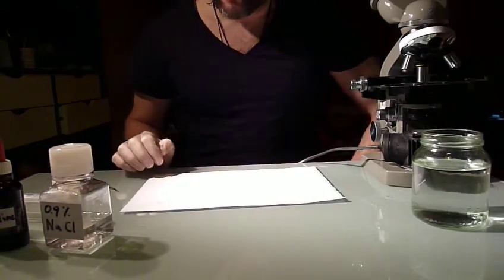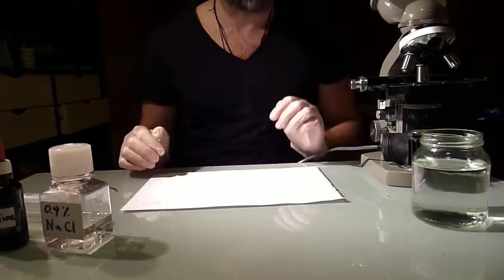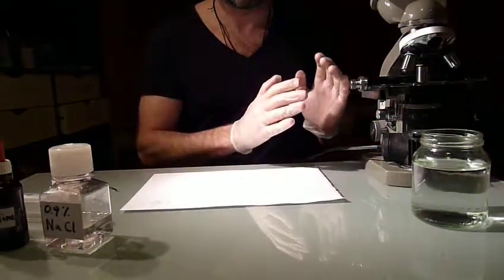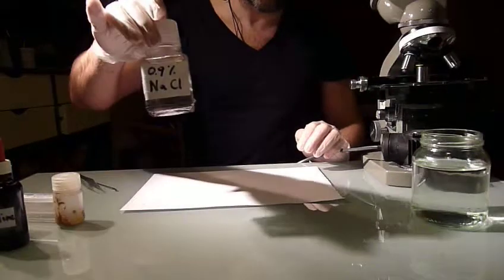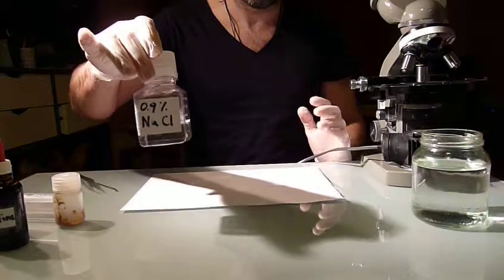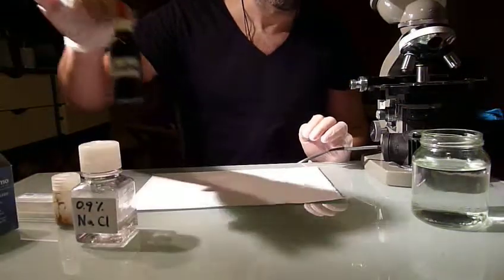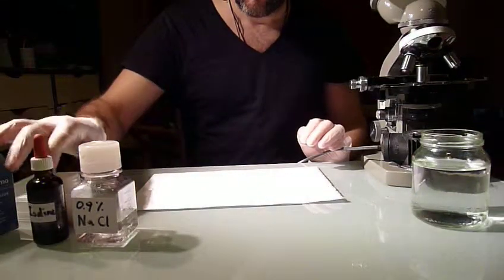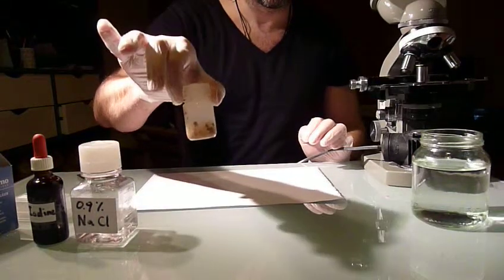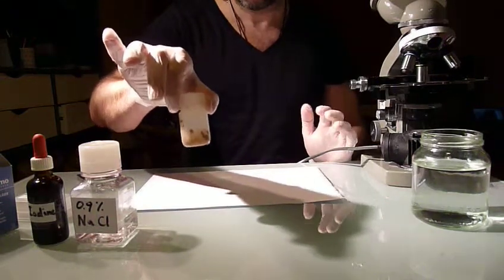Okay, this video will be about making the actual samples for the microscopy and doing the microscopy. So what you'll need for that is the saline solution. Maybe we'll need it, maybe we don't. We'll definitely need the iodine solution. We will need a sample of stool. It should be fairly fresh.